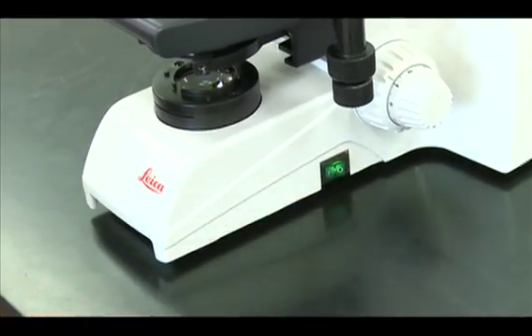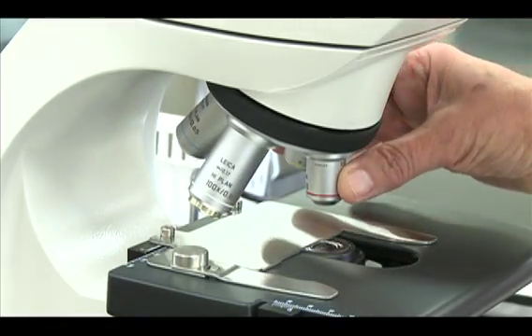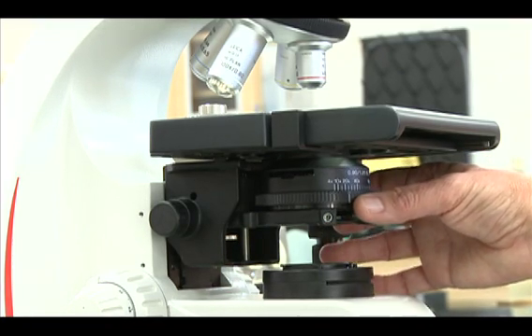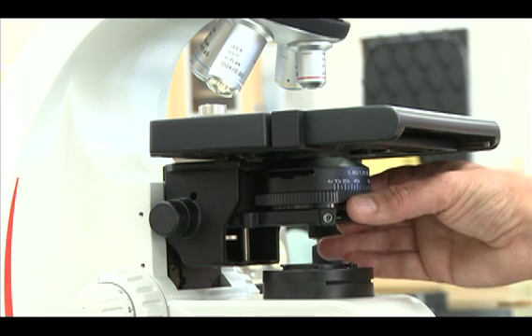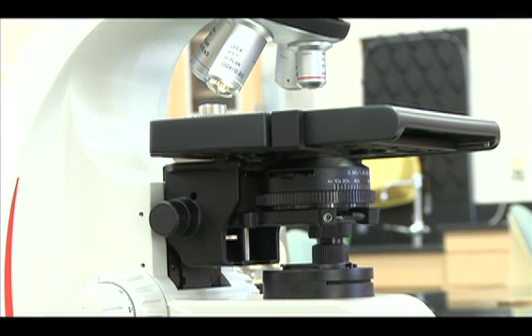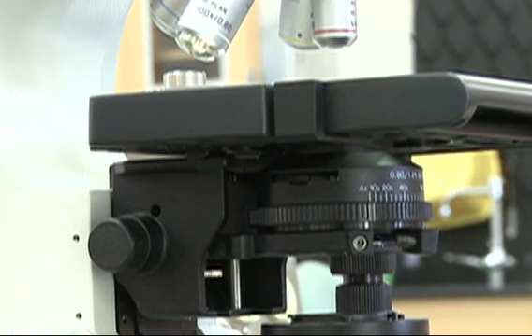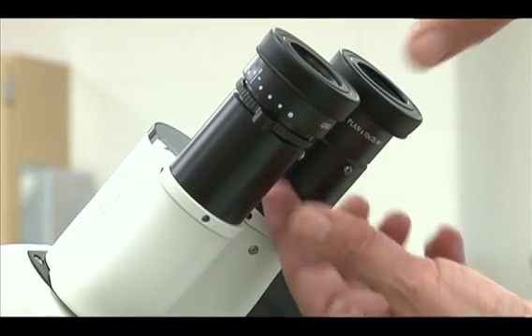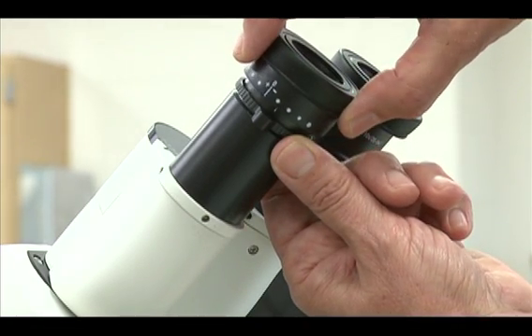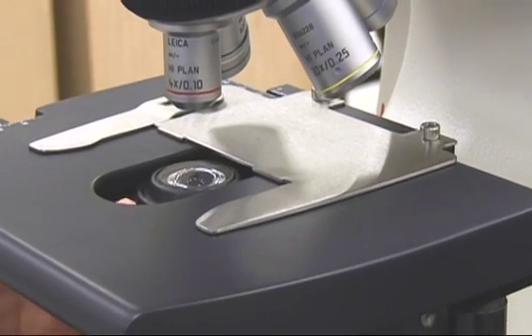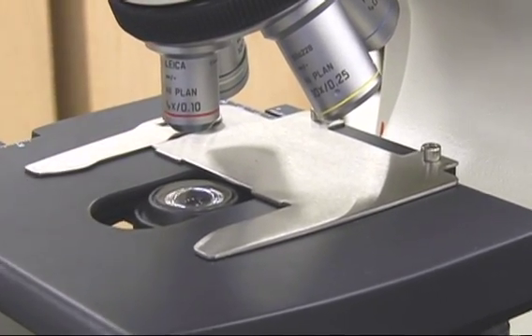Assess the microscope. The 4x objective should be in position. The iris diaphragm setting should always be equal to the objective power, so it should also be set to 4x. Set the focusing ocular to zero. The condenser should be set even with the mechanical stage.